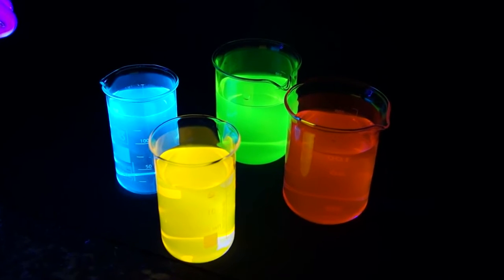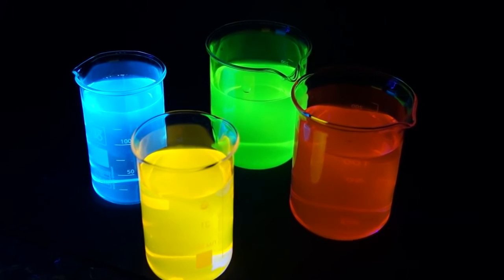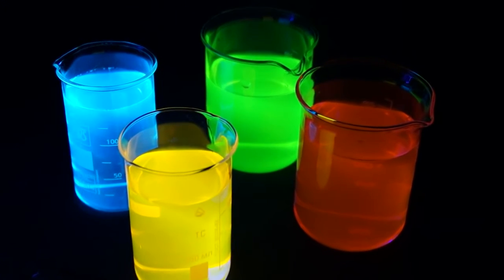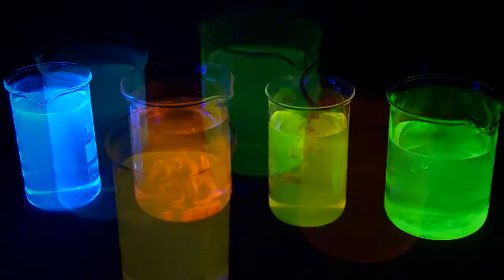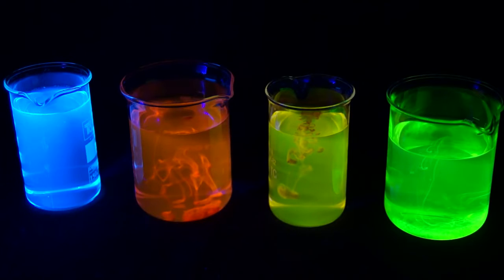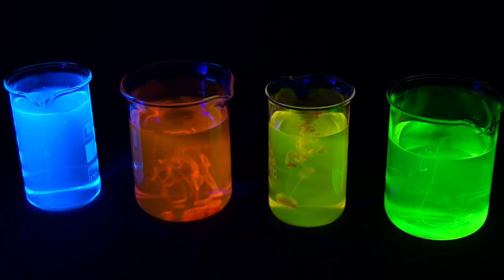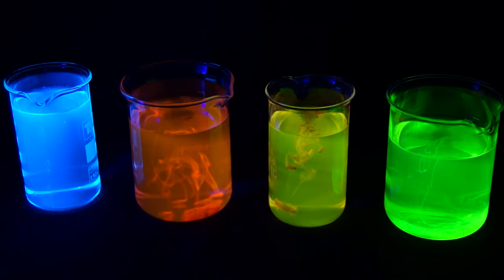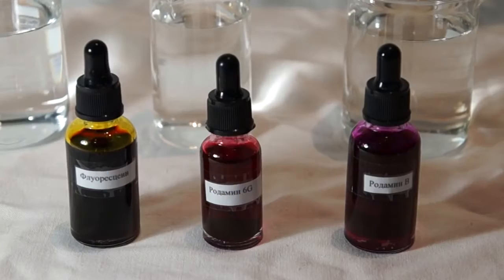Hello everyone! Today we'll conduct experiments with fluorophores, or in other words, fluorescent substances. Fluorescent substances or fluorophores are those substances which emit light by exposing them to ultraviolet rays.